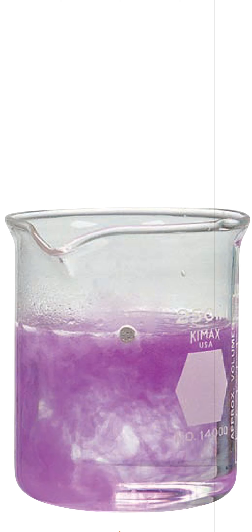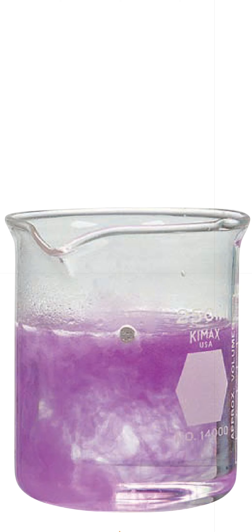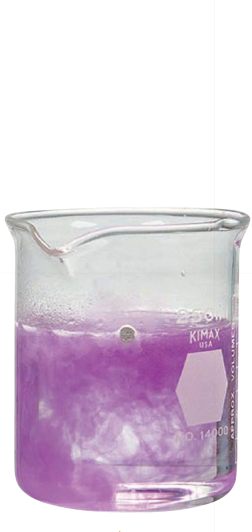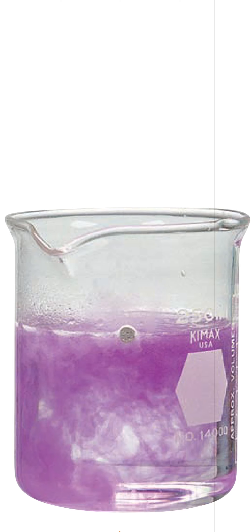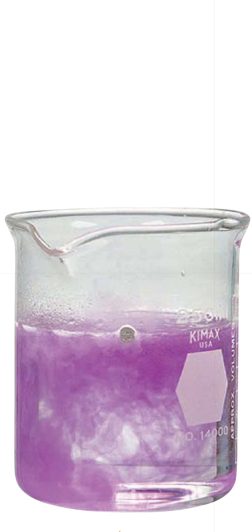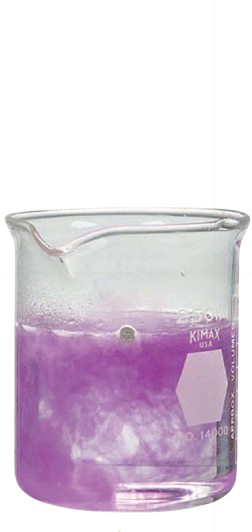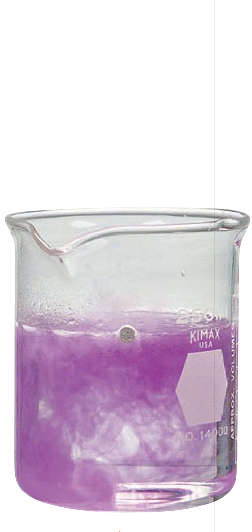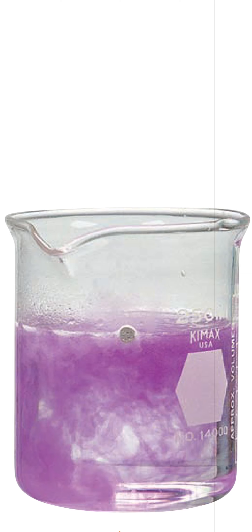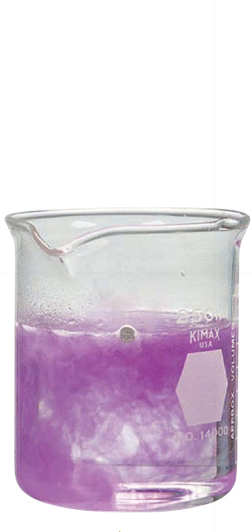So my friend, this is the reaction between sodium and water. Sodium vigorously reacts with water, and sometimes you will see fire.